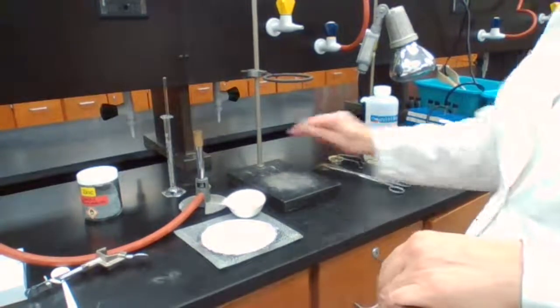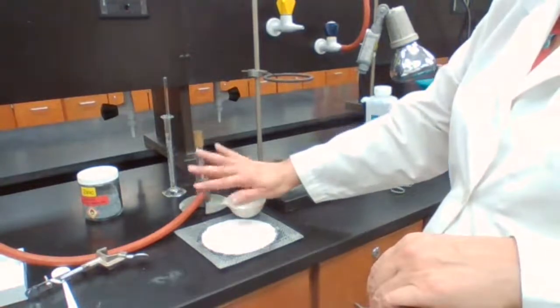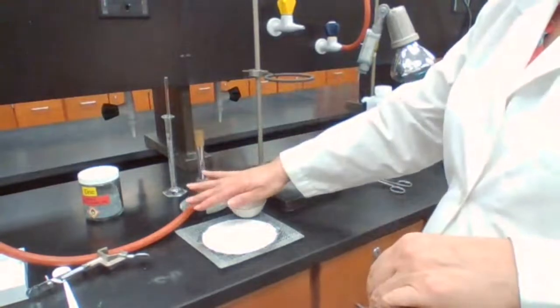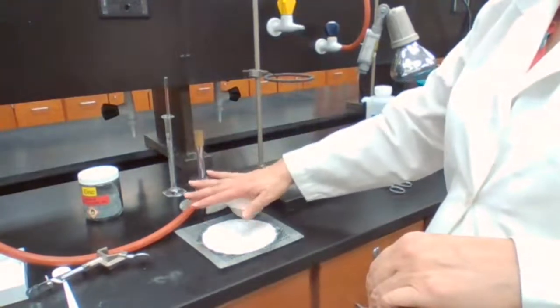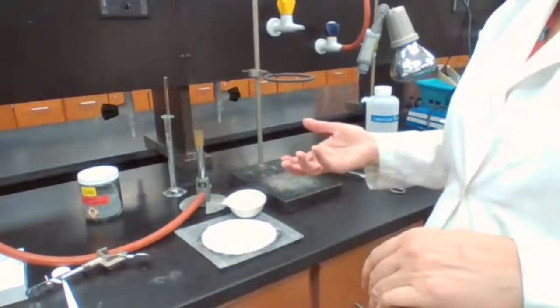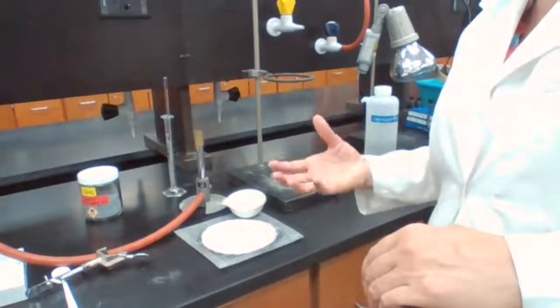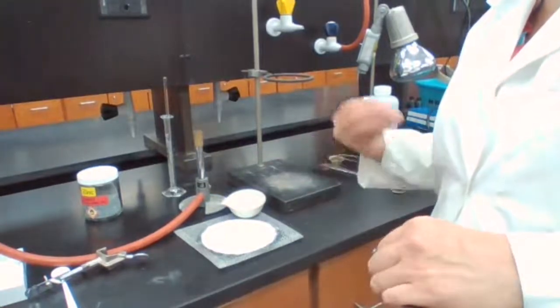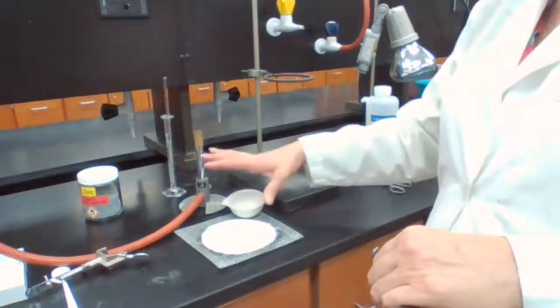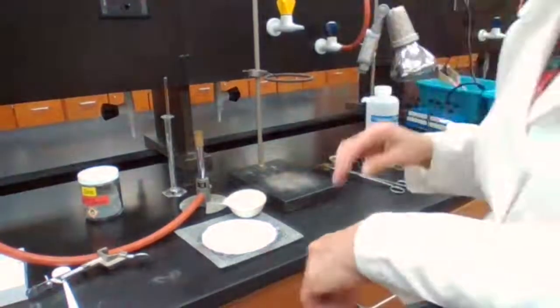The same thing again, I'm going to close my hand. If I don't feel the radiation of the heat, it's good enough for me to measure, but I still feel it. It would be a while because it's dry. There is no liquid. If we had hot water, because of the specific heat that water has, it takes longer for it to lose the heat. But for a solid like this, it doesn't have a high specific heat.